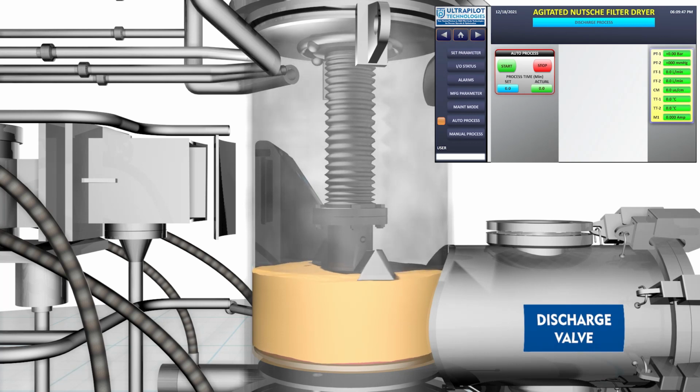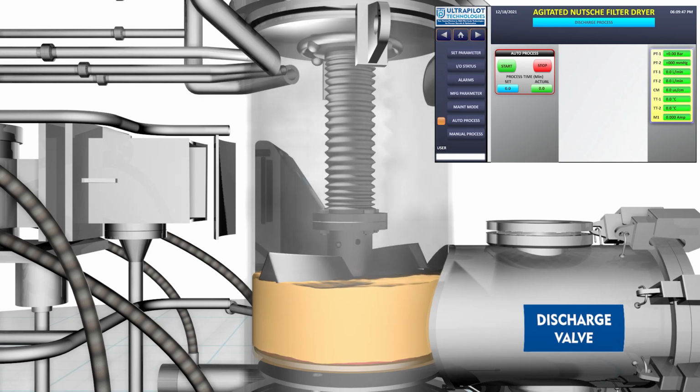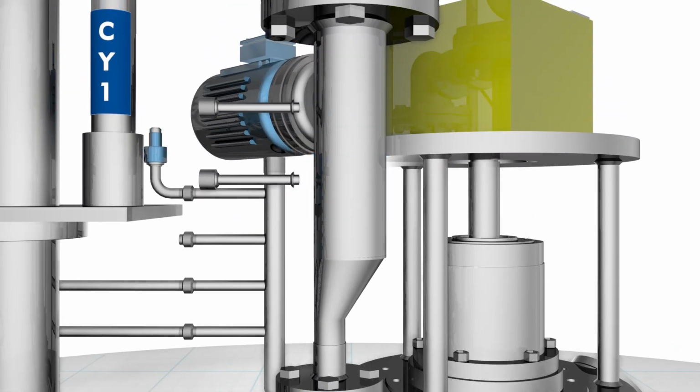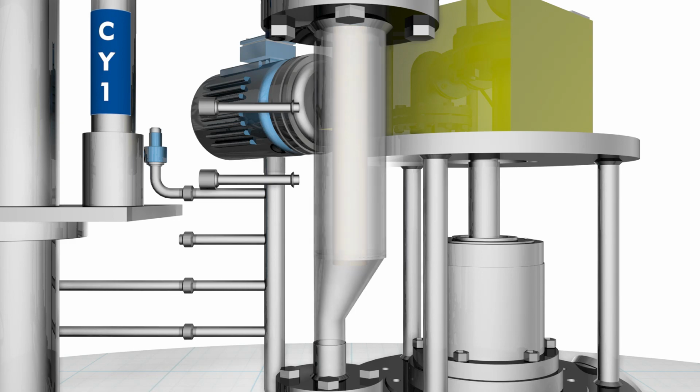Heating vaporizes the solvent in the cake, and this is sucked out by the vacuum applied below and above the bed. On drying, the dry powder may entrain with the vacuum and go into the dust collector. The dust bags are pulsed with N2 or dry air by opening solenoid valve SV1. This can be done by way of a timer provided.